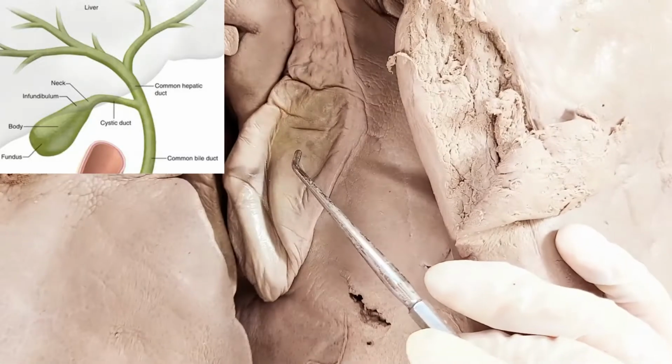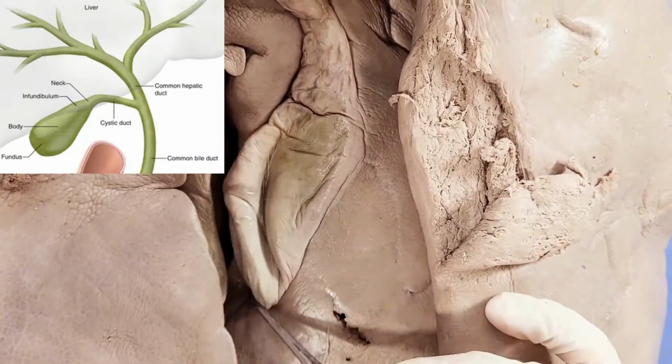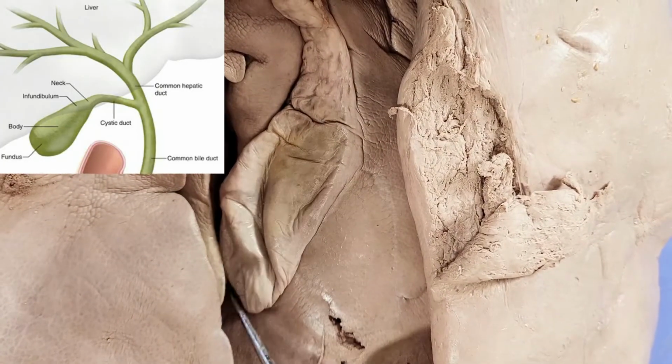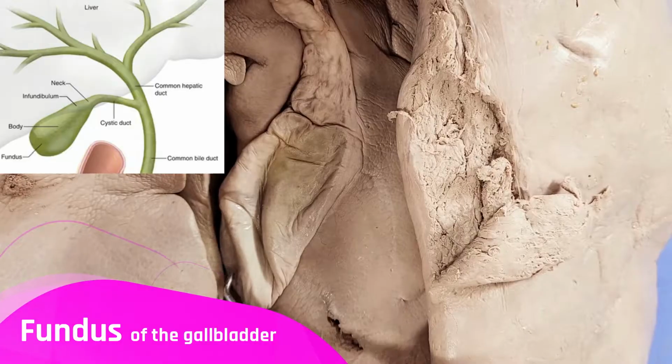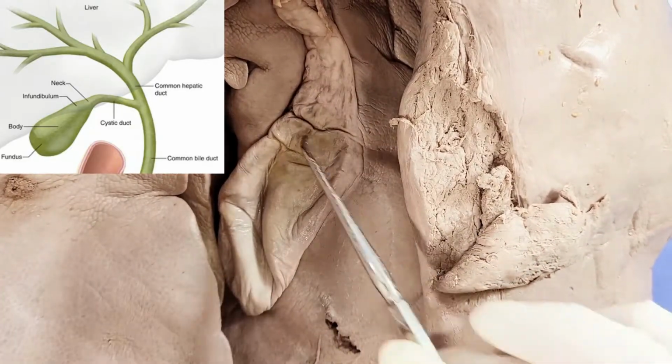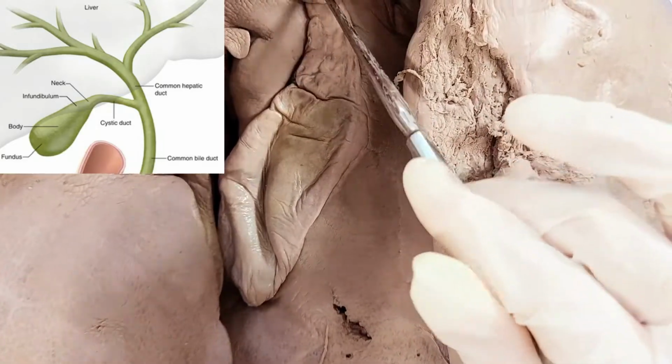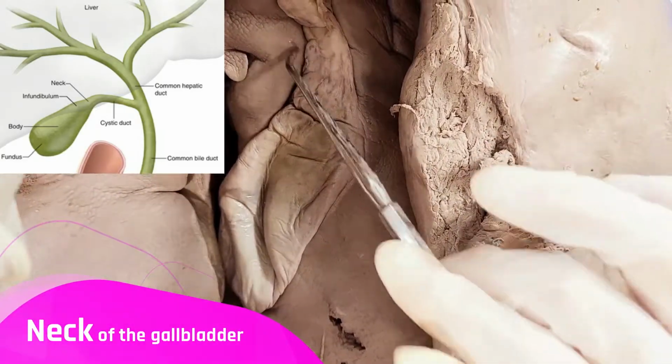So now let's take a closer look at the gallbladder. So here, this part that overhangs out from the liver and isn't really attached is called the fundus of the gallbladder. And this part that's attached to the liver is called the body. And this narrower part is called the neck of the gallbladder.